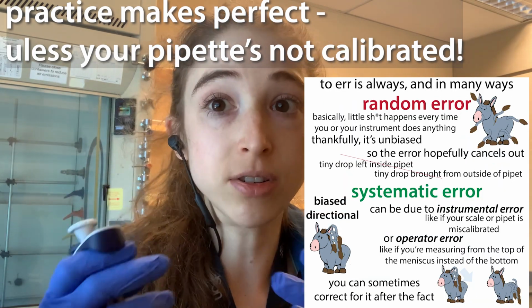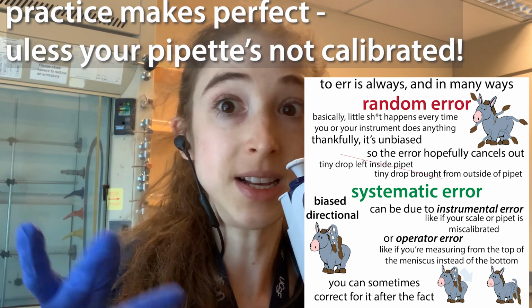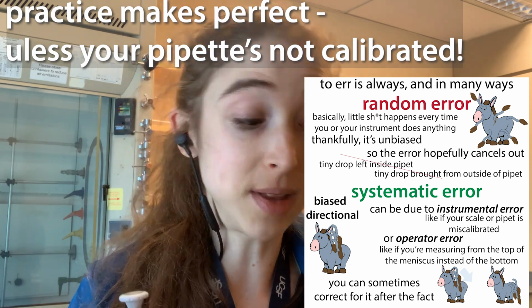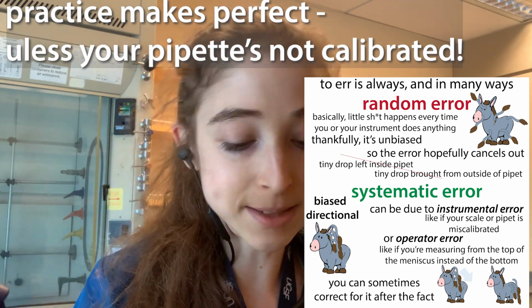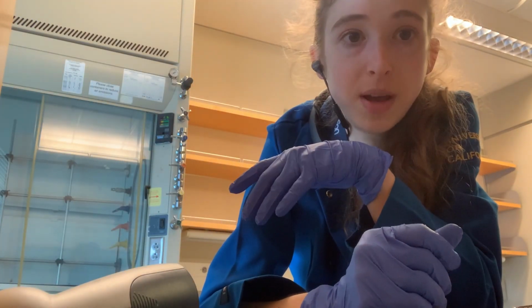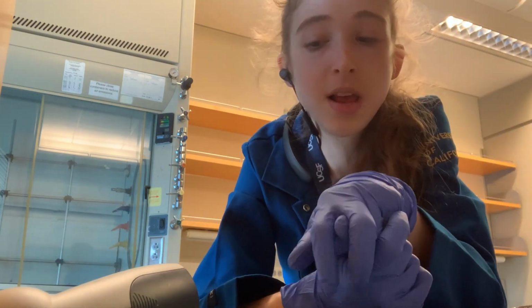Every year, typically, we get our pipettes calibrated. We just got our pipettes back from being calibrated. They test and make sure that the volume the pipette says it is really the volume that it actually is. And then you have the issue of how accurate you are when you're actually doing things. And that's the basics of all of these pipettes, and how you use them, and some specific things to keep an eye out for when you're using different types.